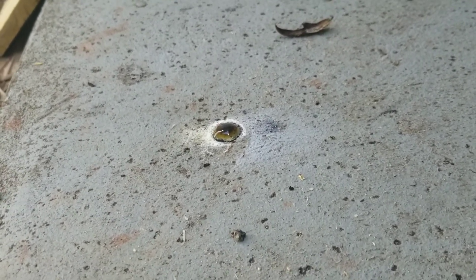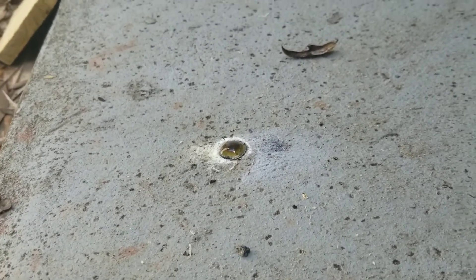There's a weird liquid right there. I don't know what that is — I'll have to figure that out. I think that's molten sodium hydroxide.